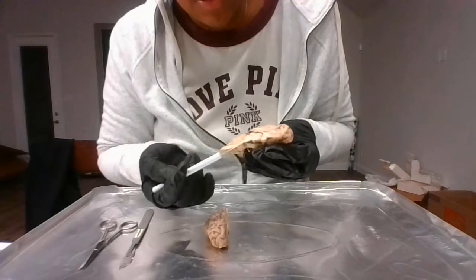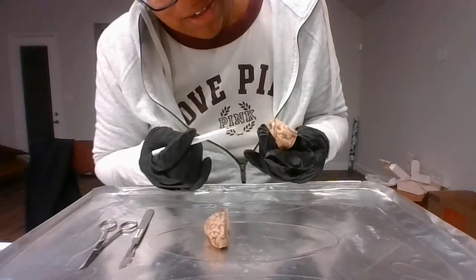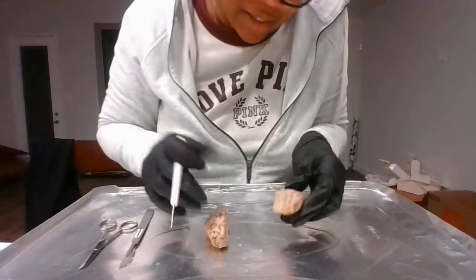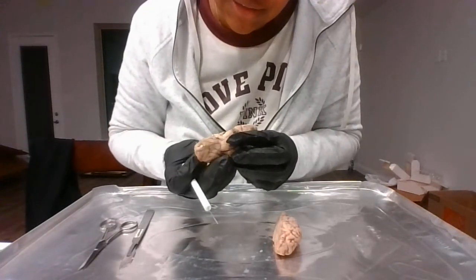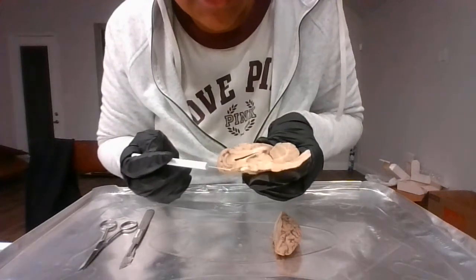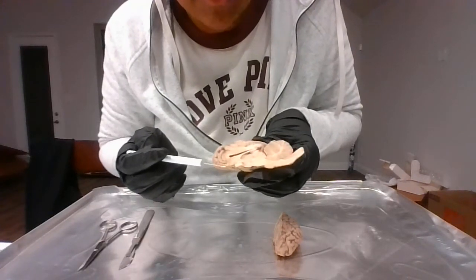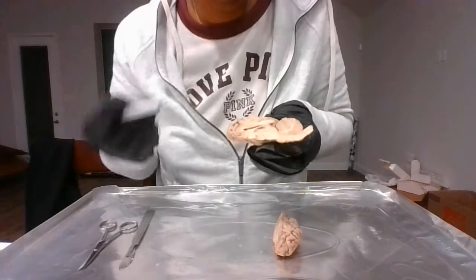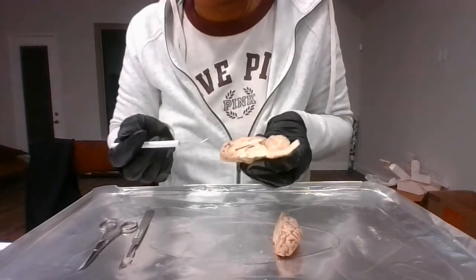And then I'm trying to find it, but there's also the pituitary gland. I can try and look for it on this other side. But the pituitary gland, I'm thinking it's this right here because there's a thalamus, hypothalamus, and the pituitary gland. The pituitary gland produces and controls our hormones. That's the main function for that.